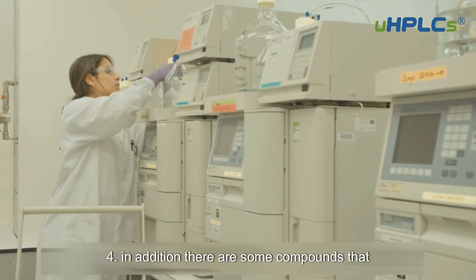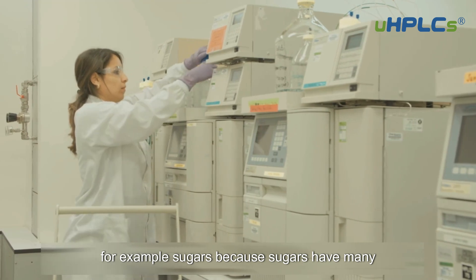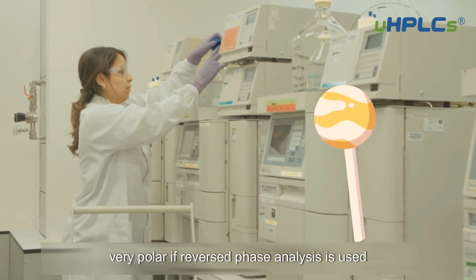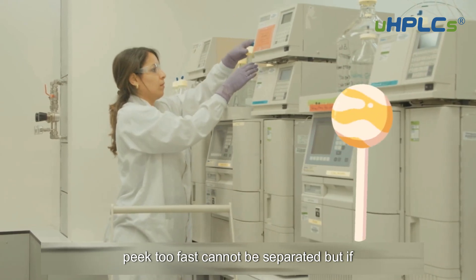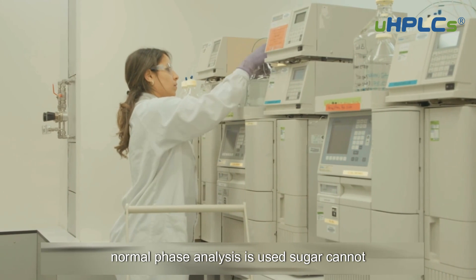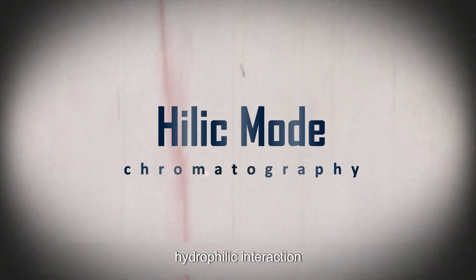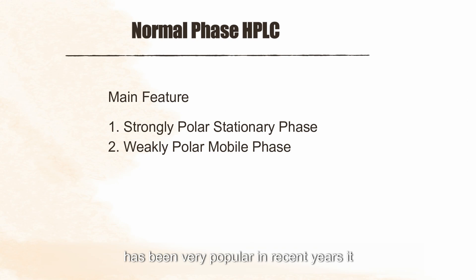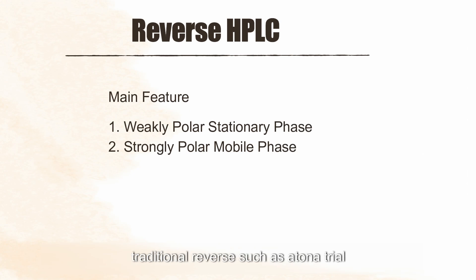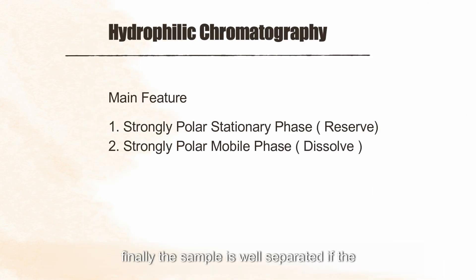In addition, there are some compounds that are not suitable for normal phase analysis and also not suitable for reversed phase analysis. For example, sugars — because sugars have many hydroxyl groups and are very polar — if reversed phase analysis is used, sugars have no interaction with C18 and elute too fast to be separated. But if normal phase analysis is used, sugar cannot be dissolved in n-hexane, so it cannot be separated either. In this case, we can try using HILIC mode — hydrophilic interaction chromatography. Research on HILIC applications in LC-MS has been very popular in recent years. It uses a column similar to normal phase, such as silica gel, with a mobile phase similar to traditional reversed phase, such as acetonitrile-water. This combination can dissolve the sample and retain it, allowing the sample to be well separated.